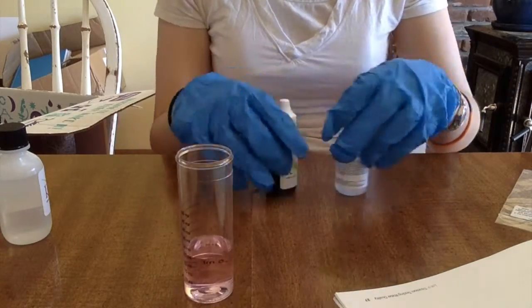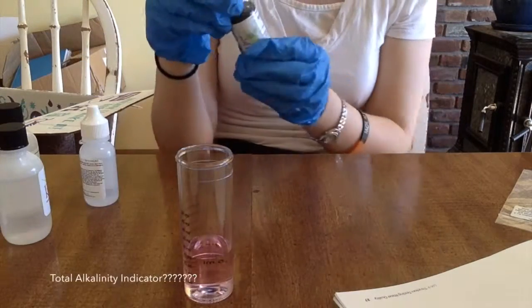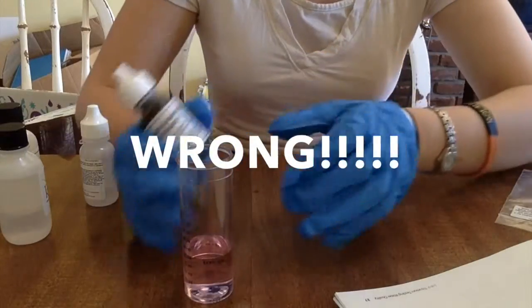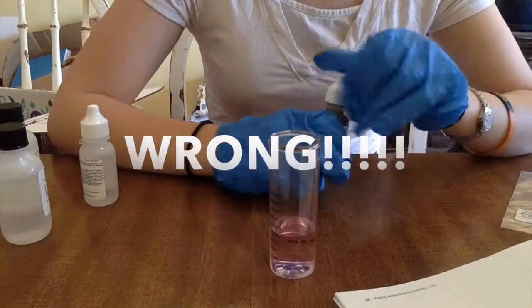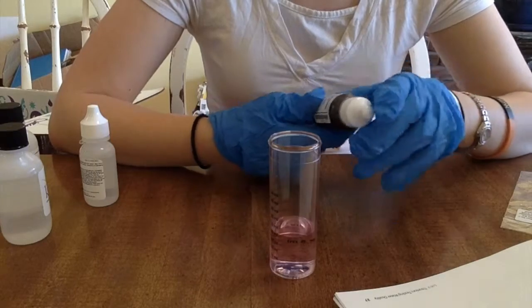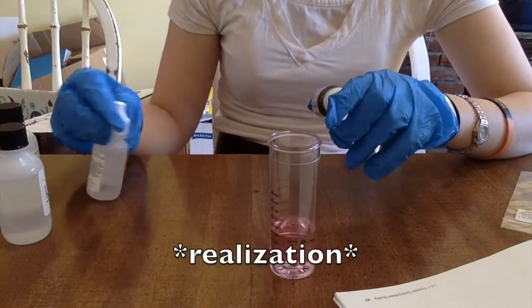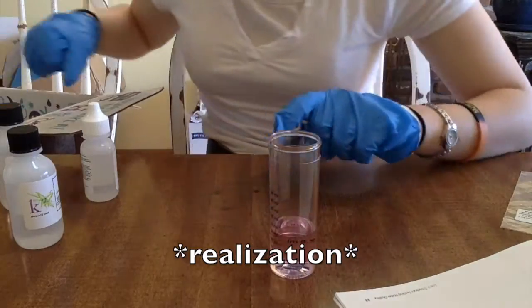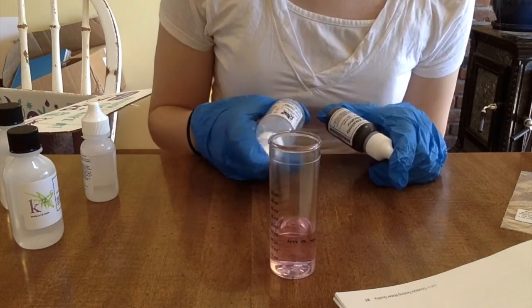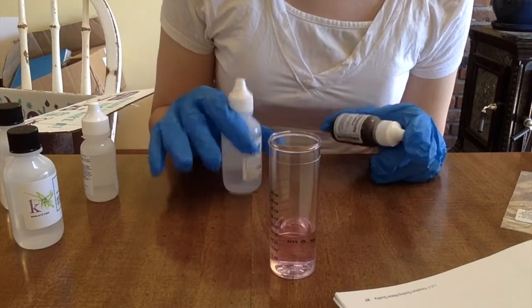Next, the drops of titrant low — it says total alkalinity indicator on the bottle, but in here it calls it alkalinity titrant low. One drop. This titrant is a 0.12 N solution of sulfuric acid in water. Sulfuric acid. It says a 0.12 N solution of sulfuric acid in water.